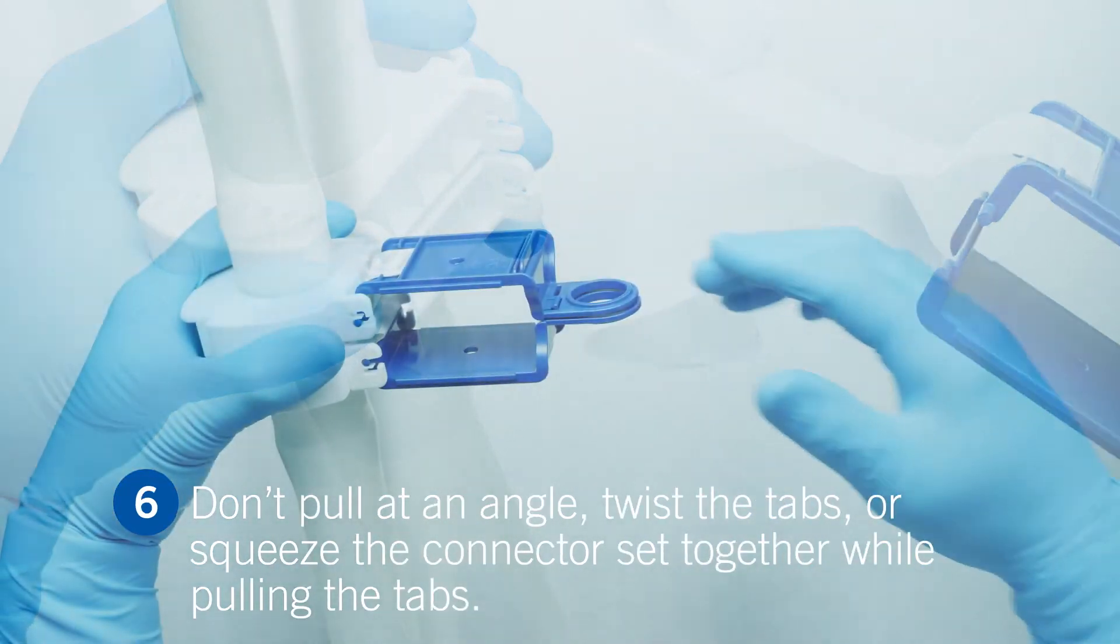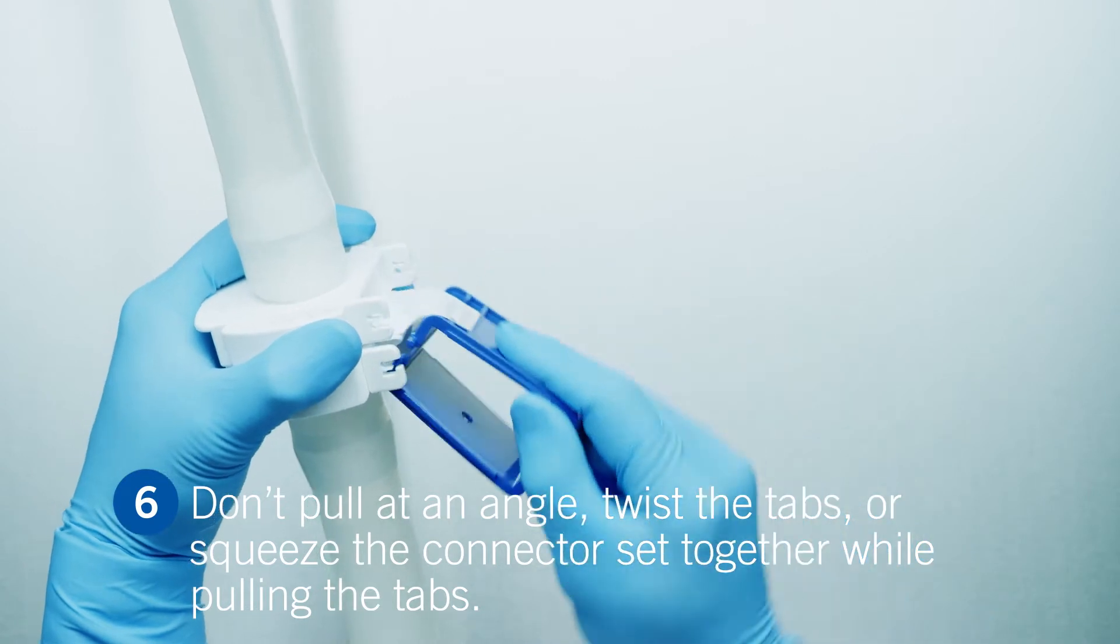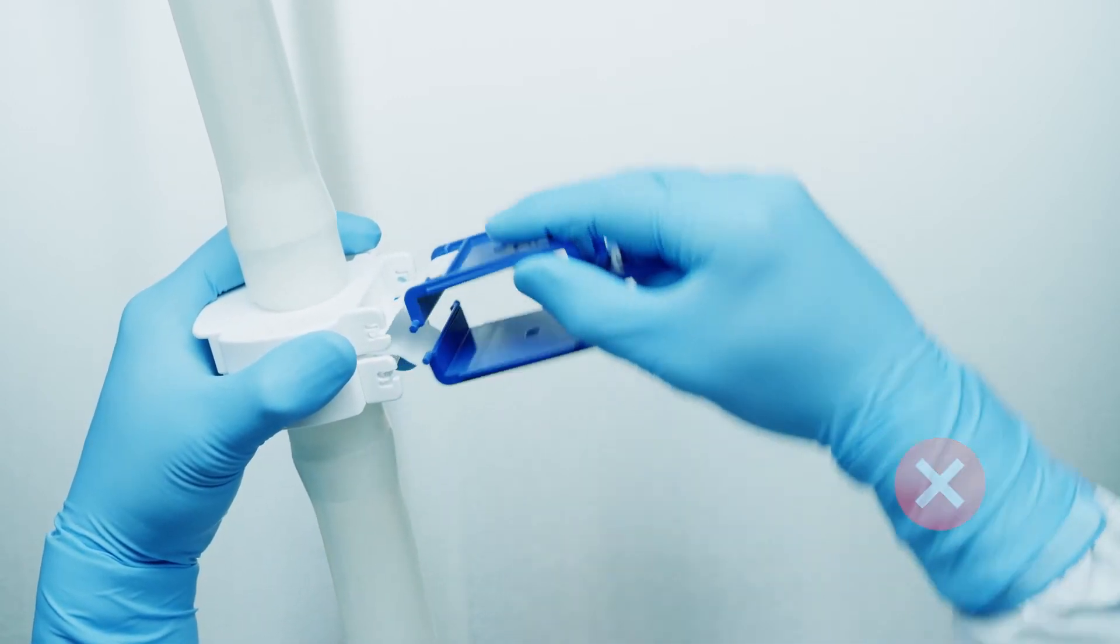Make sure you don't pull the tabs at an angle, twist them, or squeeze the connector set together while removing the membranes.